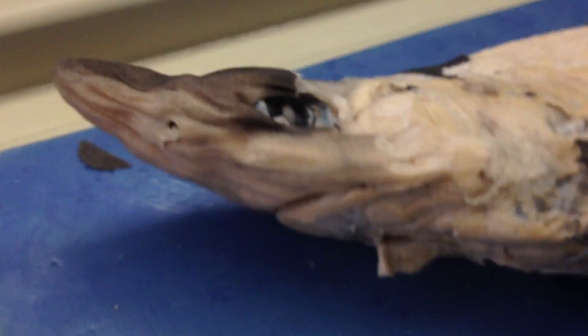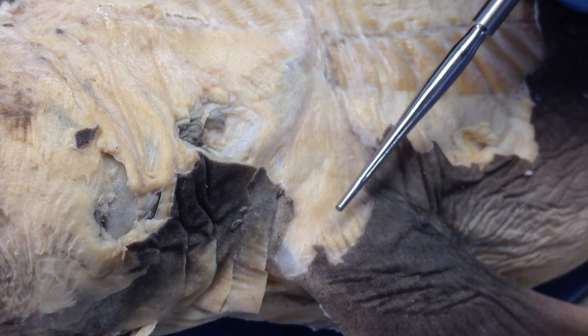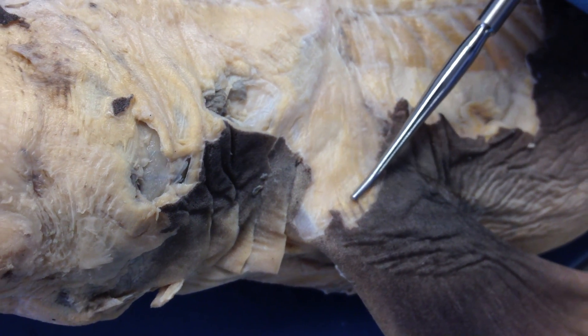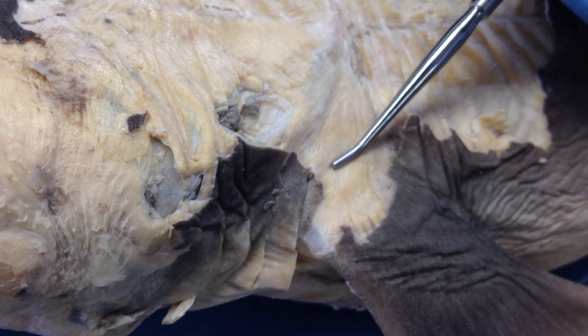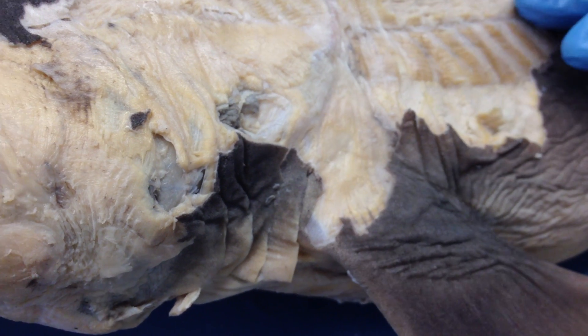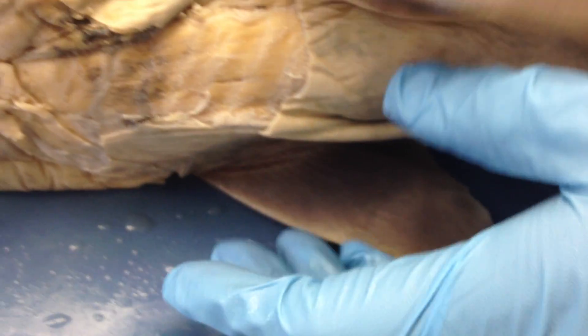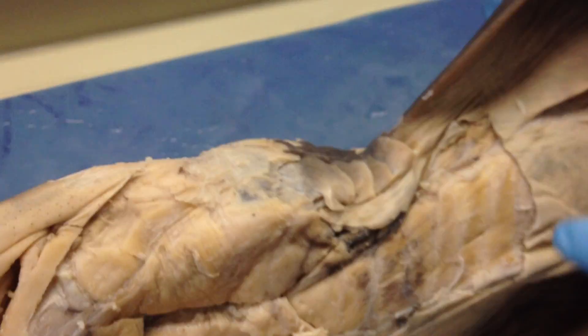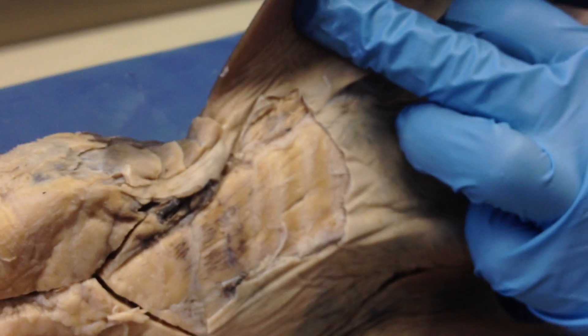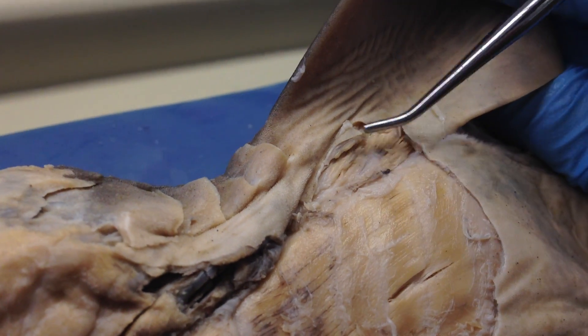The superficial dorsal fin muscle is located on the pectoral fin, on the dorsal side, right here. The ventral fin muscle is likewise on the pectoral fin, on the ventral side.